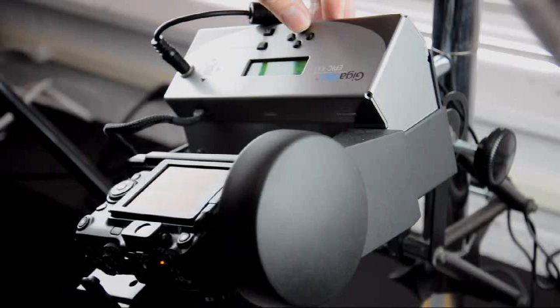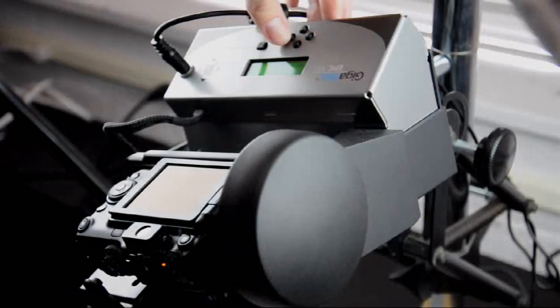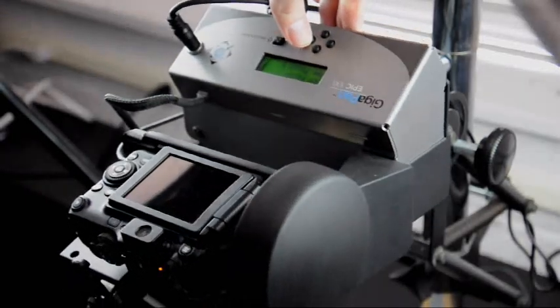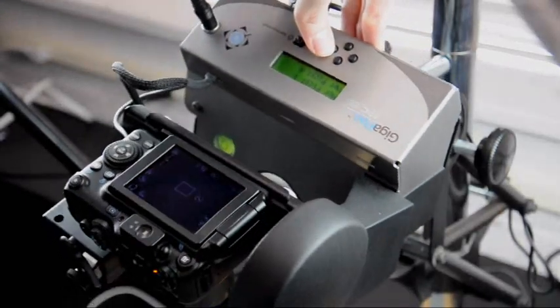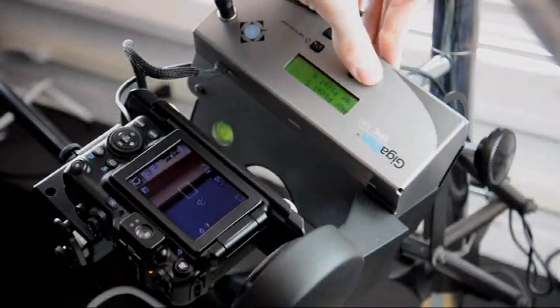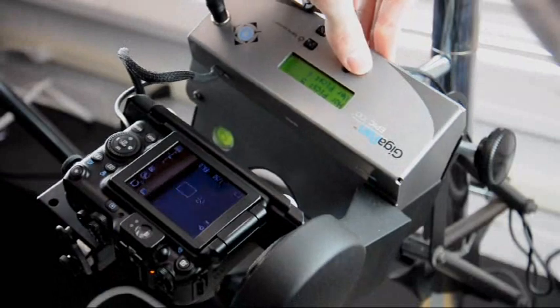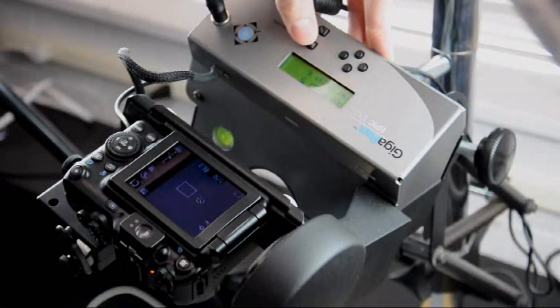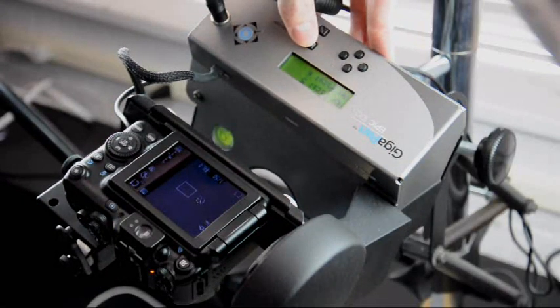Once all settings are input, the robot asks the user whether to start. Once initiated, the robot begins shooting and finishes by itself.